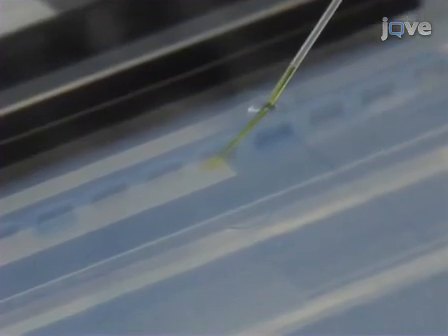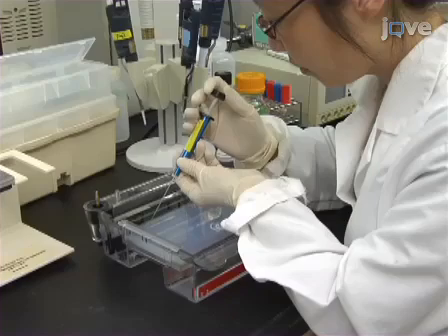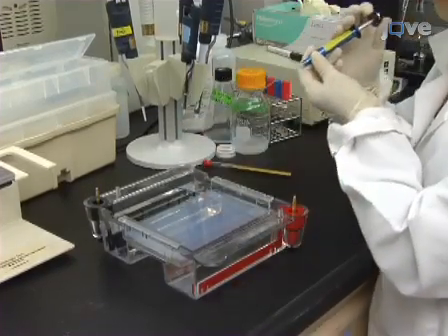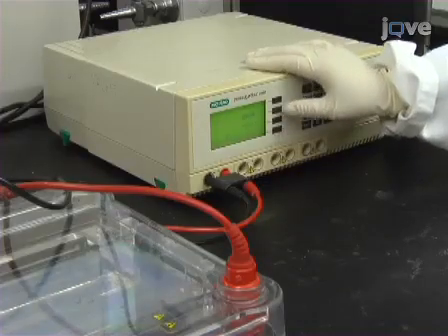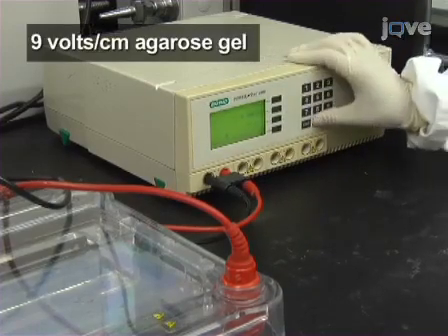Be careful not to puncture the well with the capillary or introduce an air bubble into the well by continuing to turn the plunger after the last of the liquid has left the capillary. Once all the samples and standards are loaded, set the constant voltage of the power supply to 90 volts.